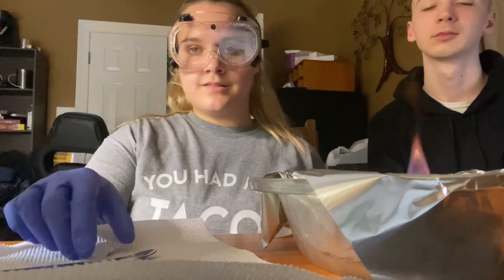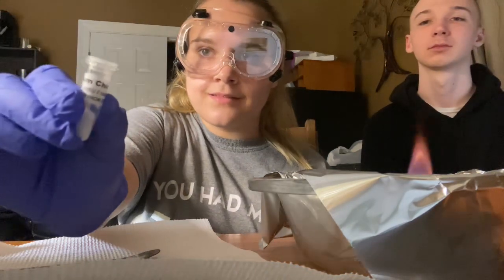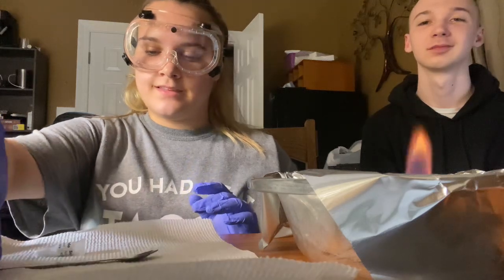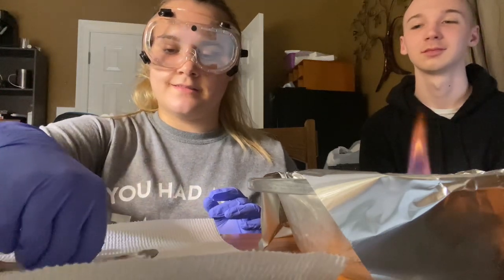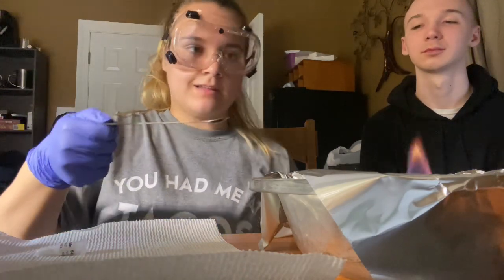So the next color test we're doing is with sodium chloride. So, yeah, salt. So let's see what color change this makes.